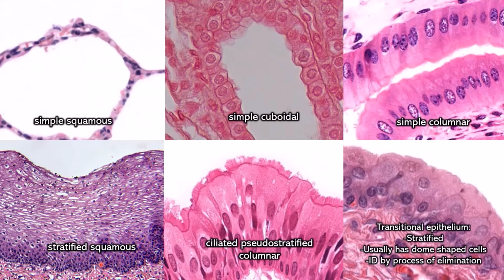As soon as you see cilia, you should suspect ciliated pseudostratified columnar. And you are going to confirm that by looking at those multiple rows of nuclei. Now, if you don't remember, why is this called pseudostratified, not regular stratified? Because all of these cells are attached to the basement membrane. They're all attached to the bottom. So really there's only one row. It's just that some of the cells are short and some are tall, so the tall cells have their nuclei up here, and the short cells have their nuclei down there.